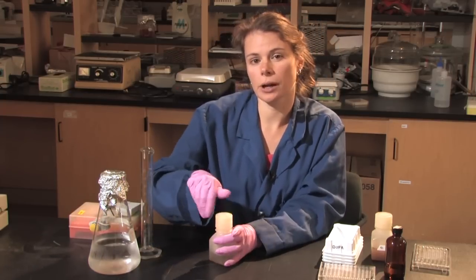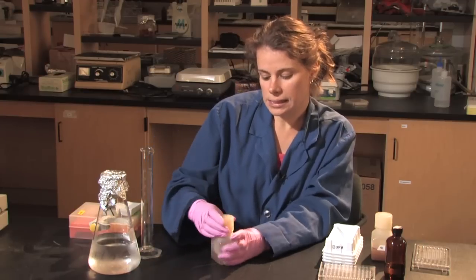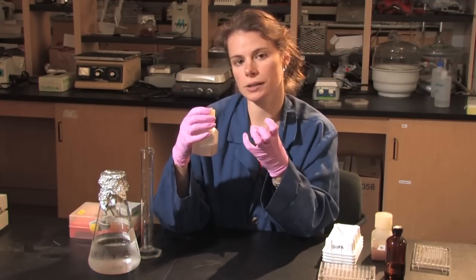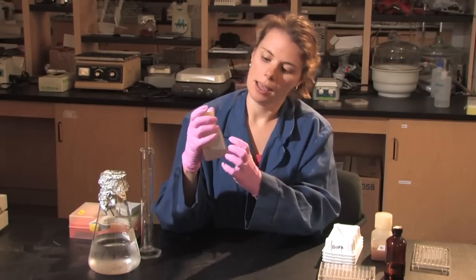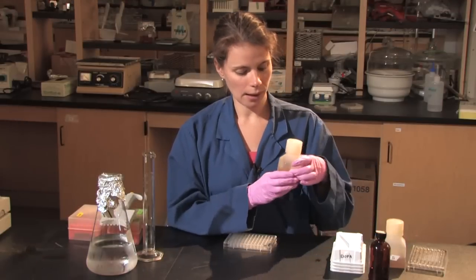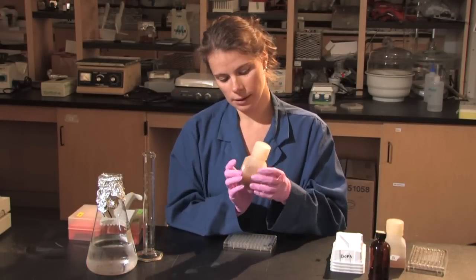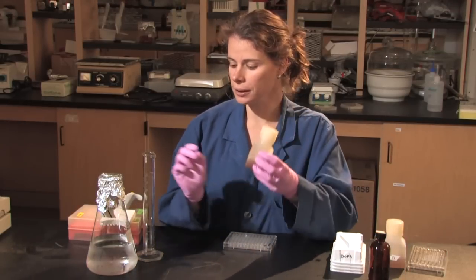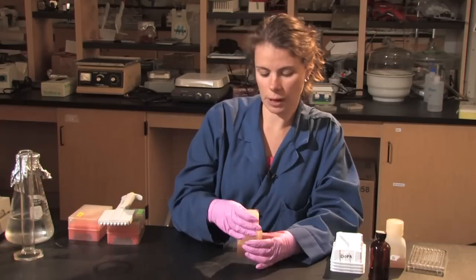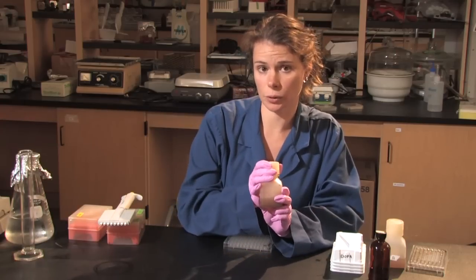And these are then going to be put on a shaker. The glass beads within the sample will cause the soil particles to break up and hopefully release any enzymes that are held within the soil particles. I have this one that's been shaking for an hour. And I've also added an additional 50 ml of the buffer. So I now have 100 ml of the buffer with the 0.5 grams of soil.